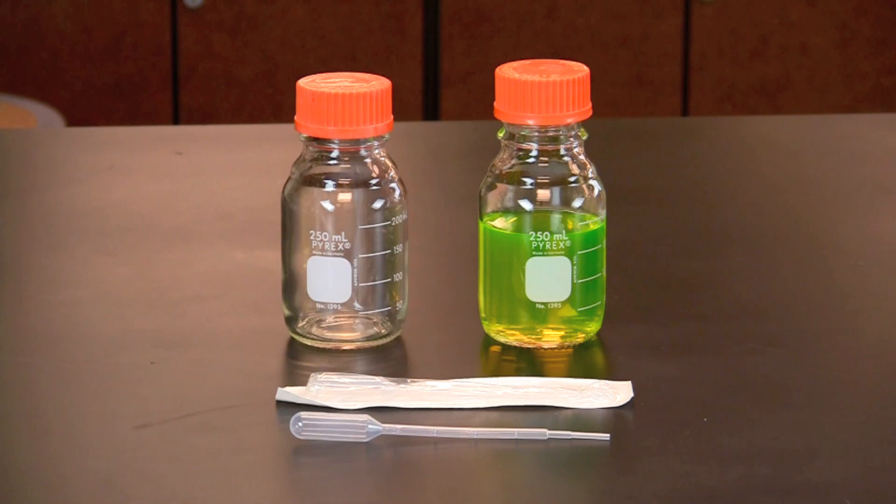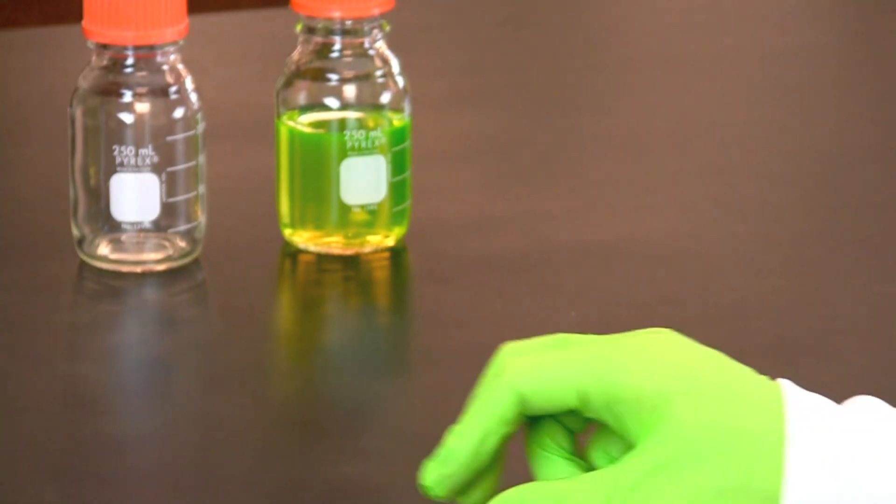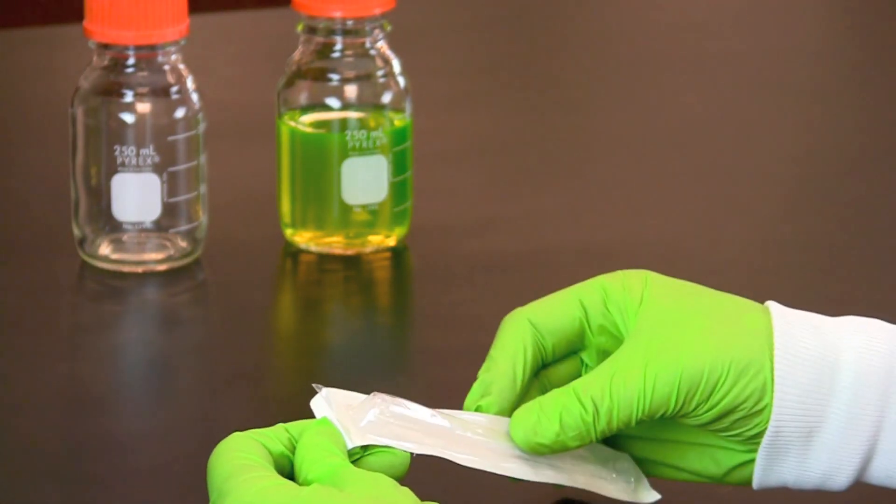In this video you will learn how to use a transfer pipette. We will be using a disposable plastic transfer pipette, or DPTP, also called a transfer or bulb pipette.